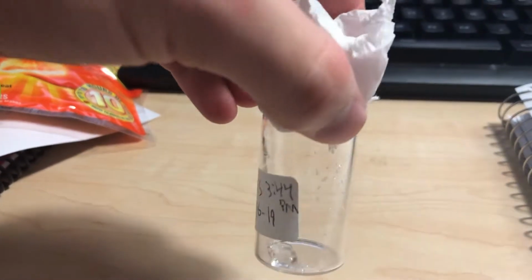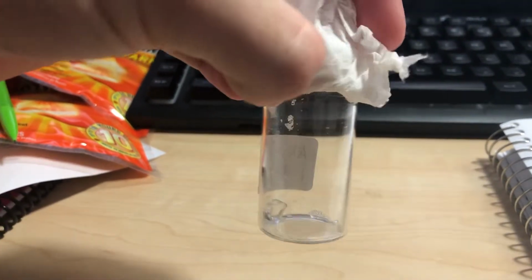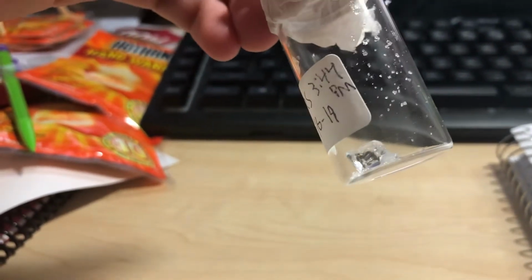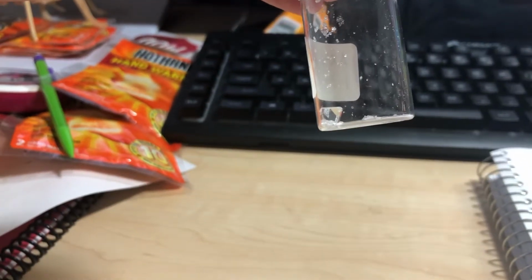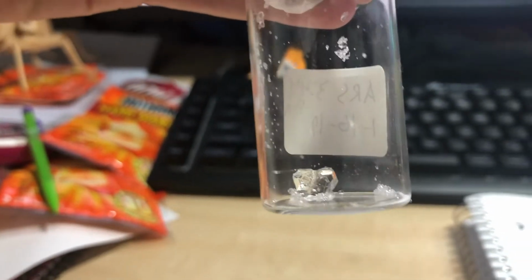As you can see, there has been some crystalline growth on the sides of the vial from when it got knocked over, but the rest of the solution has completely evaporated now, leaving the bulk of it as this chunk of a crystal down here in the bottom. And as you can see from one side, it does tend to have a more triangular shape, while from the other side, it has a kind of rectangular shape. It looks like it got chipped off a bit there, but I actually think it looks pretty cool if you just move it around in the light.